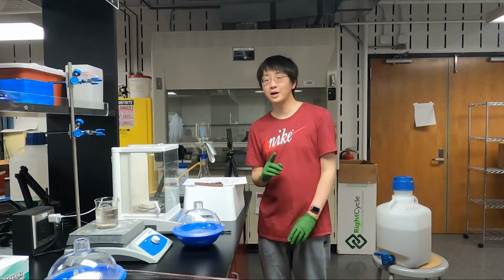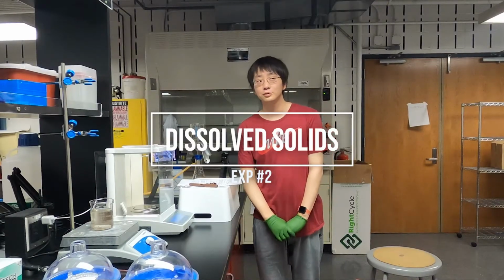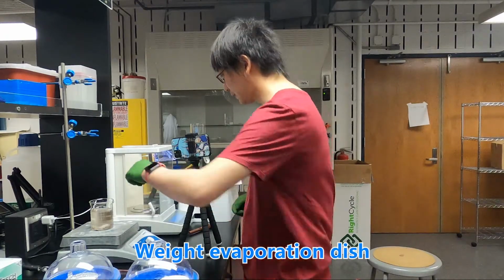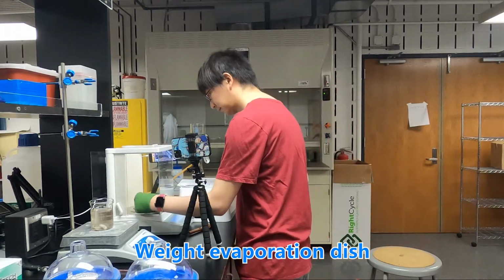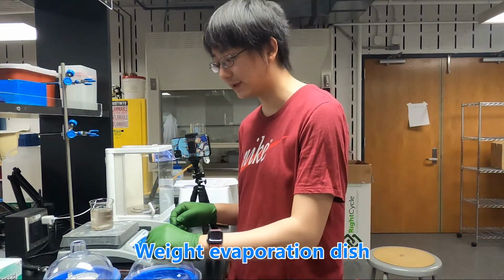And then next, we are going to do dissolved solids. So now we are going to measure the dissolved solids. At first, we weigh the mass of the dish. And after weighing the dish, we are going to store it in a desiccator.